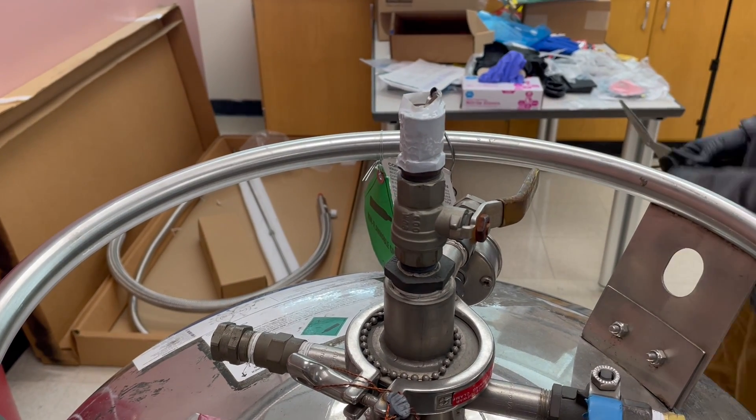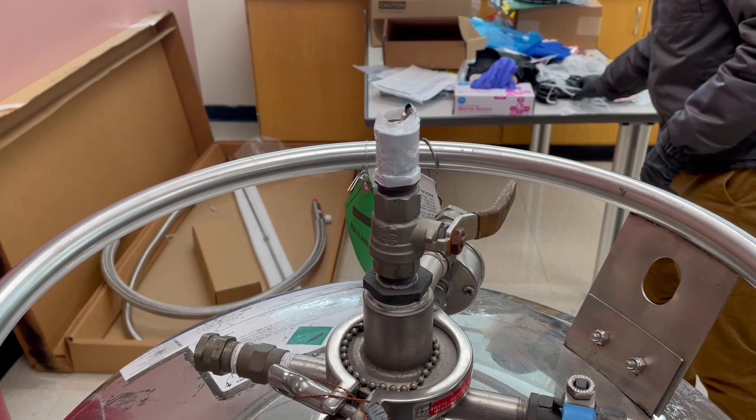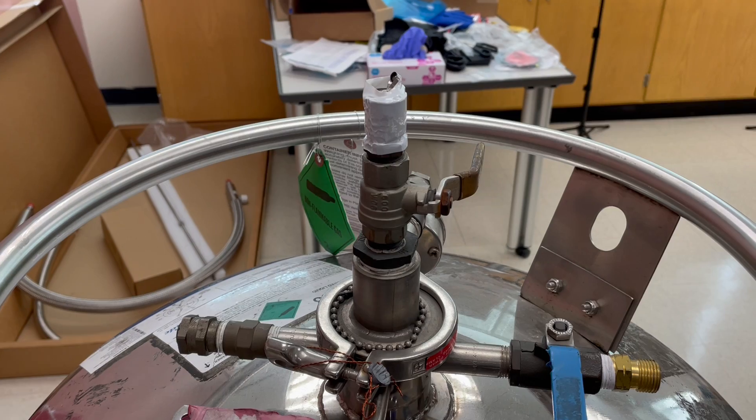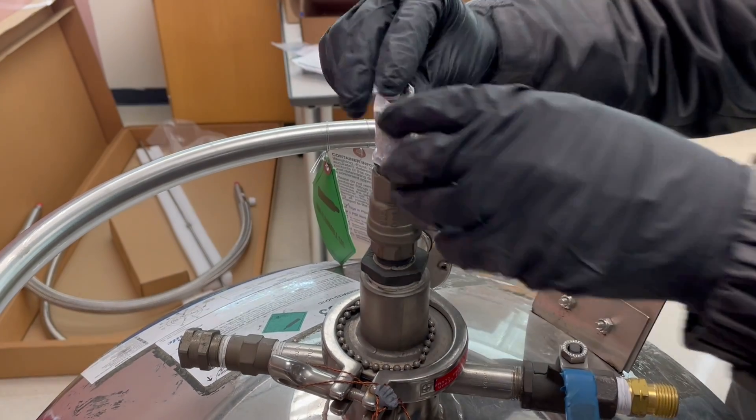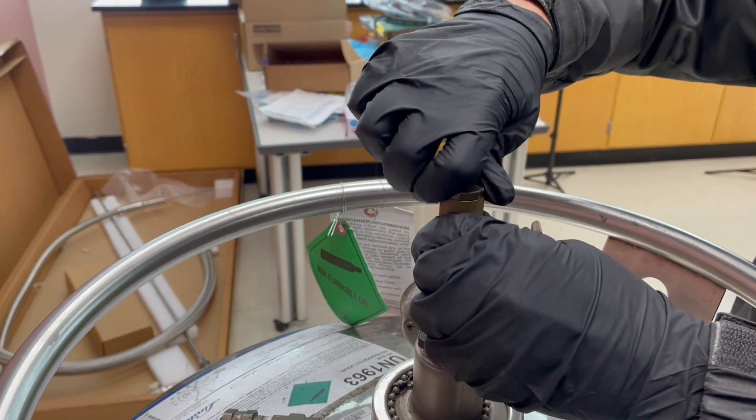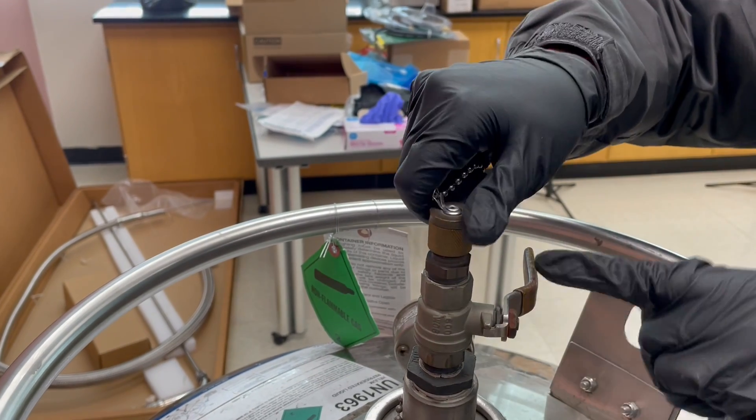And we are going to insert the transfer line to this one. Of course, I can turn this on now, it doesn't matter, because the valve is here.